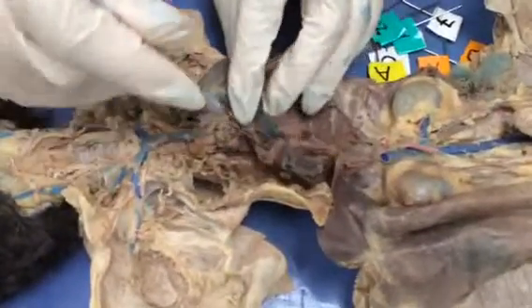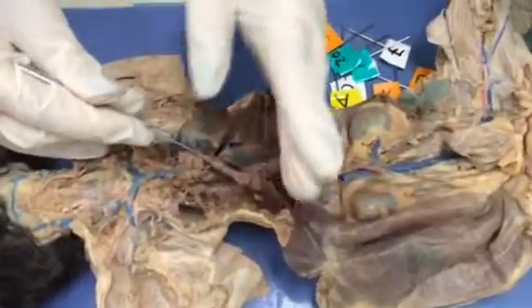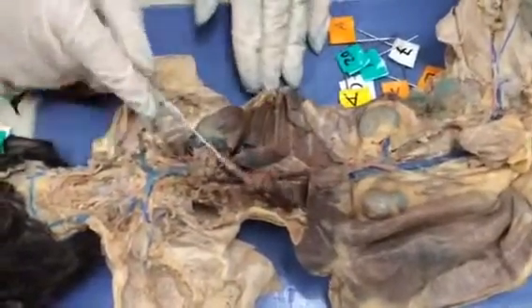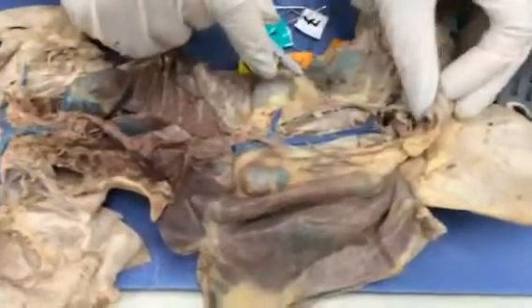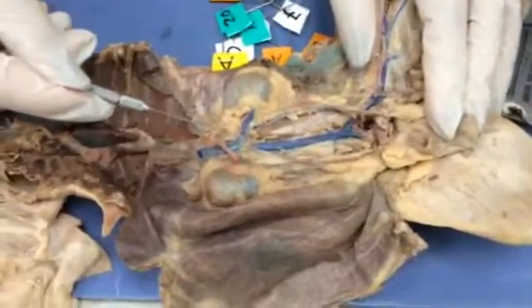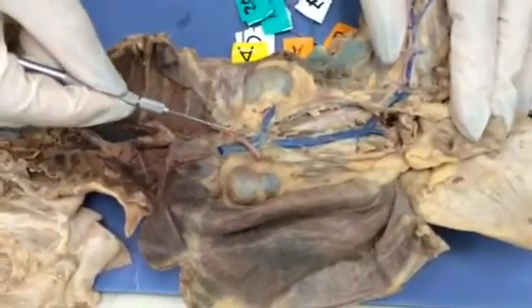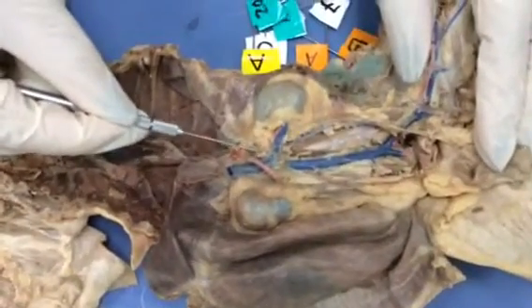We continue the journey and we'll see the inferior vena cava after it passes the thoracic cavity. We'll see it here in the abdominal region. This long vein is the inferior vena cava. Then we'll see branches that drain into the inferior vena cava. Here we see the adrenolumbar vein, and our point of reference is the adrenal gland.